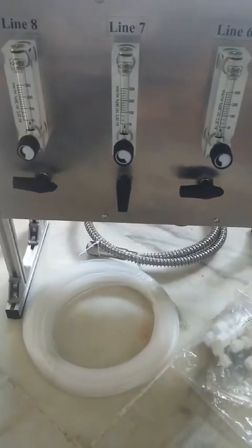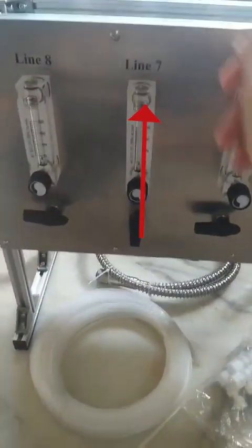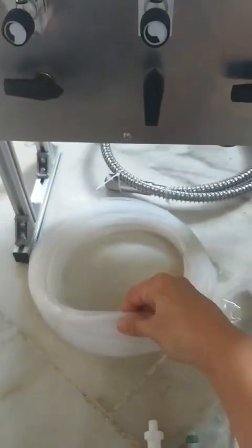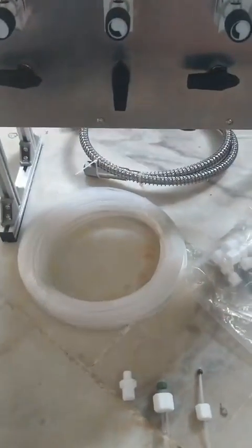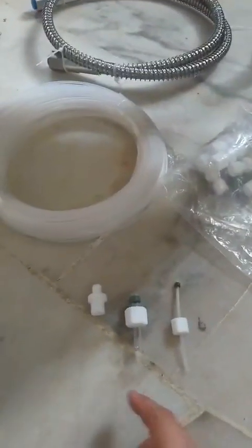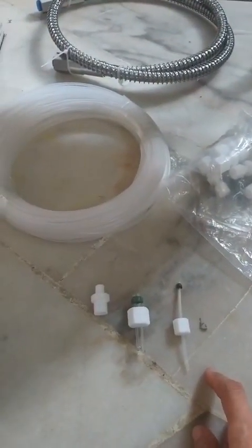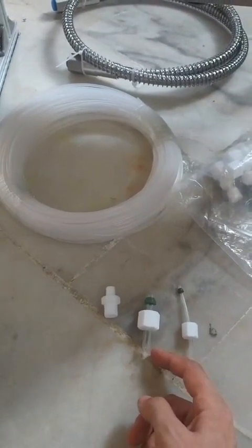When the gas comes in from the bottom and goes out from the top, you can connect to the flexible tube that we prepared for you, and at the same time you can use this device to adapt from the tube into your glass device.